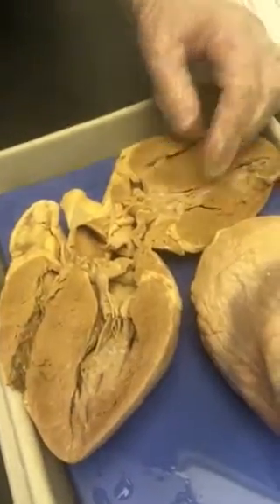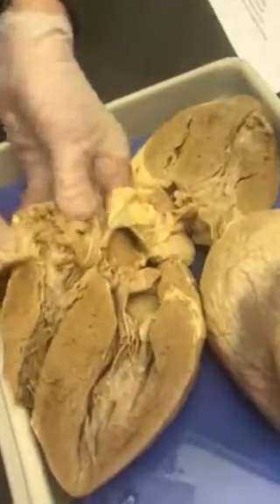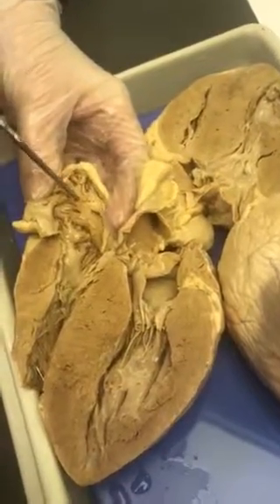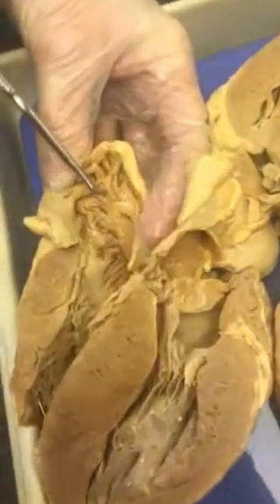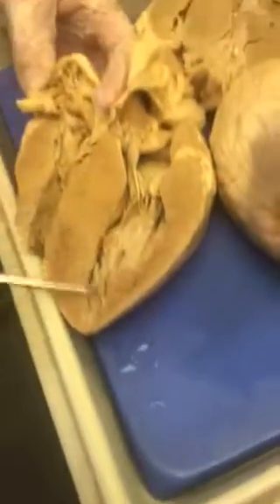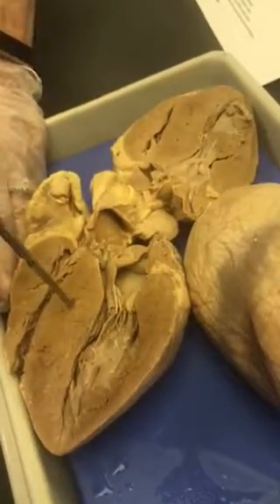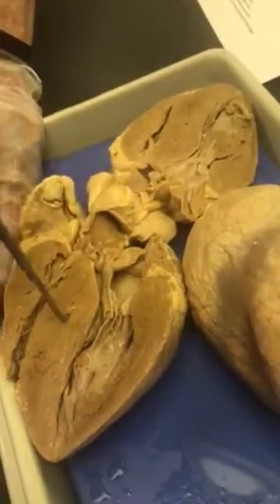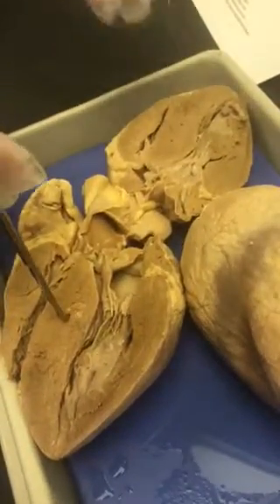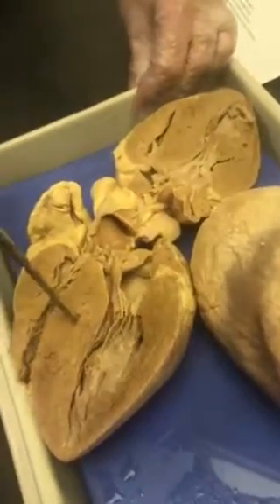And then inside the atria, these ridged muscles here, if I have a pin here and say name the muscle, it'd be pectinate muscle. So pectinate, papillary, and myocardium. Now if I say name the structure between the two ventricles, then the structure is going to be the interventricular septum, and I've cautioned y'all not to do intra. Make sure you have inter, because those two prefixes mean different things.